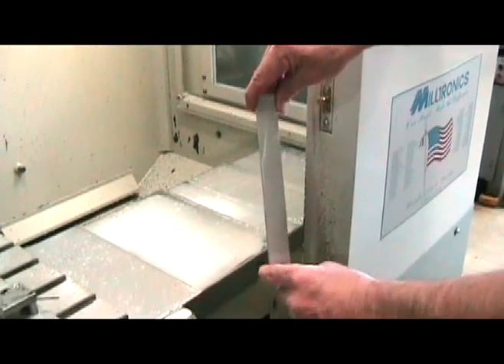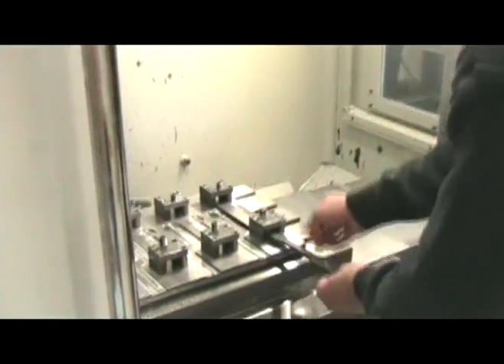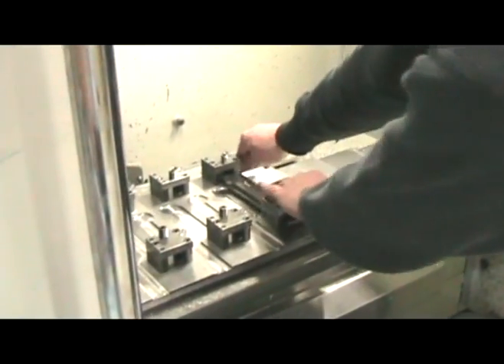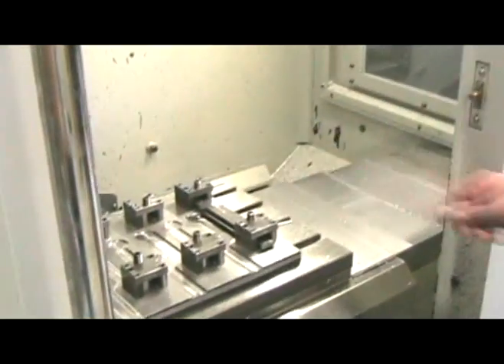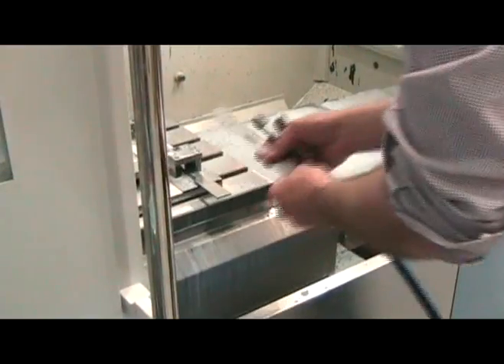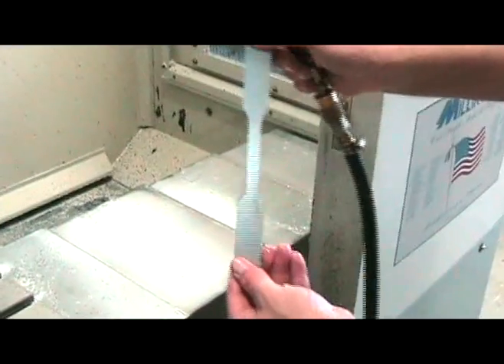It is important to carefully prepare the specimens to ensure that no stresses or burrs are introduced that could affect the properties to be measured. The samples are first sheared and then milled to the desired shape.